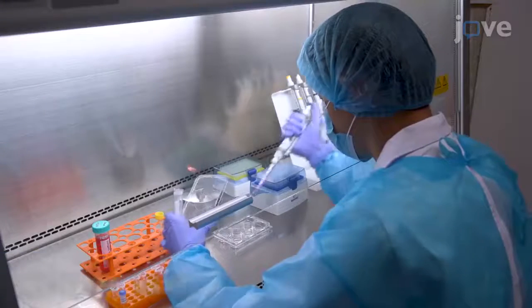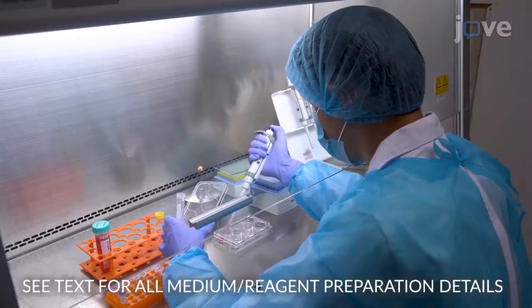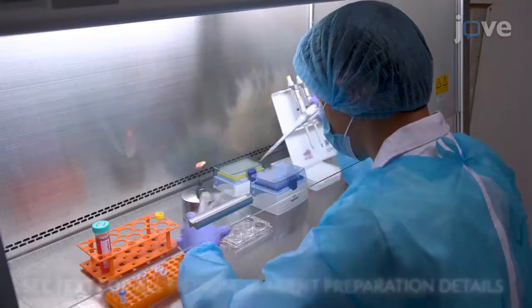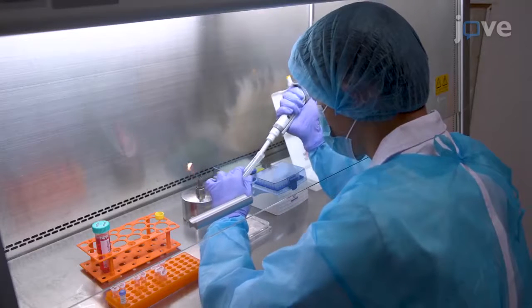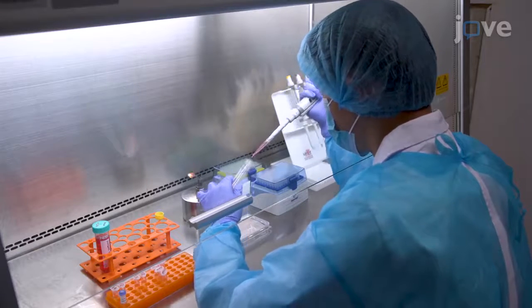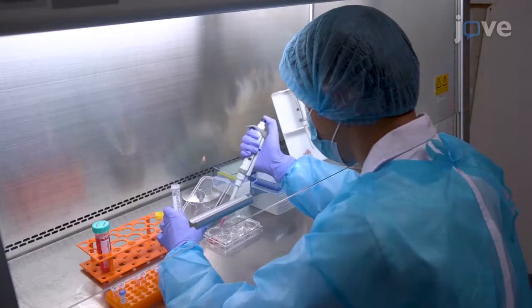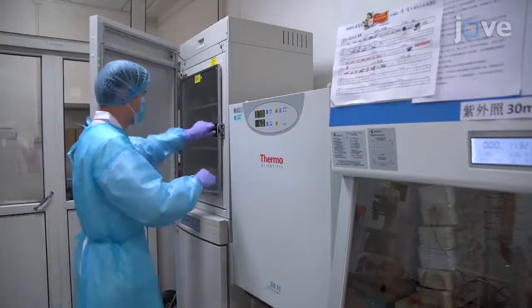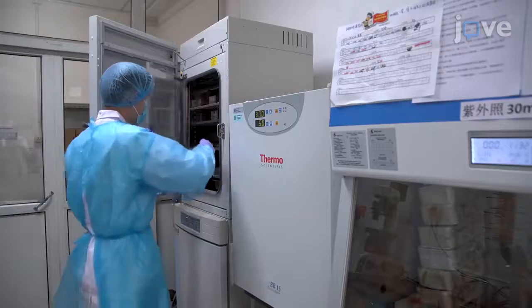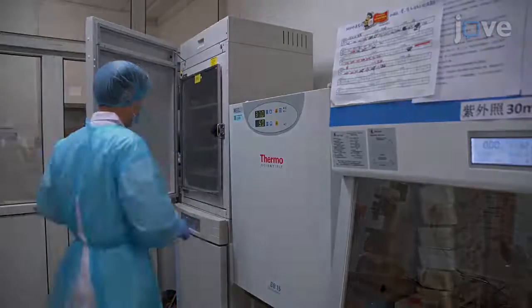For lentivirus packaging and production, seed 1×10⁶ of 293T cells in 2 milliliters of DMEM supplemented with 10% fetal bovine serum per well into a 6-well plate. Culture overnight in a humidified incubator at 37 degrees Celsius and 5% carbon dioxide.